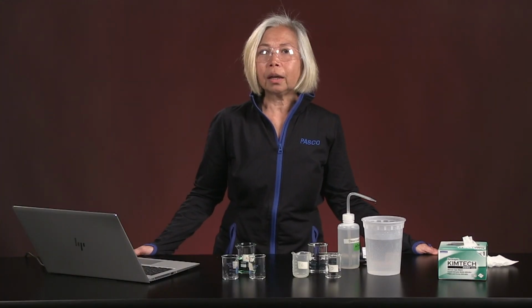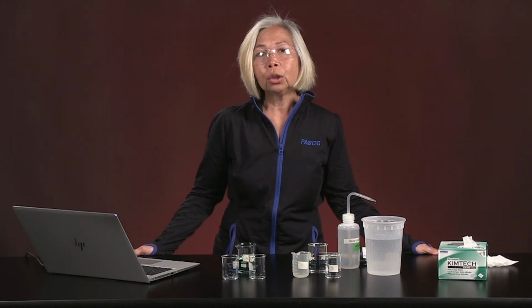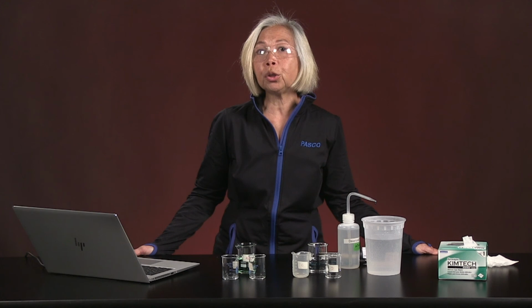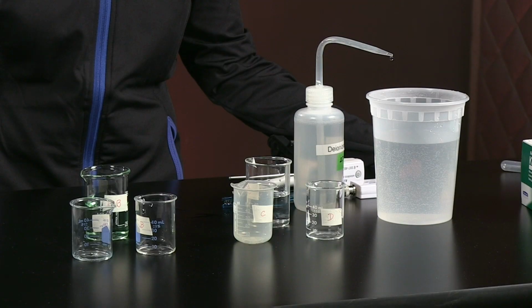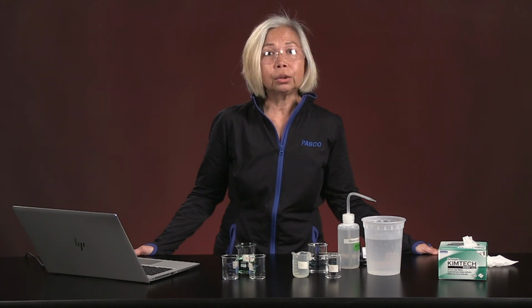To analyze your data, I first would like to ask you to look at the data you just collected from this lab. Look at all the parameters for each of the individual solutions, and then look what happened to those parameters when you mix them. So in your solutions, I want you to look at what AB and CD look like compared to the original solutions A and B and solutions C and D.